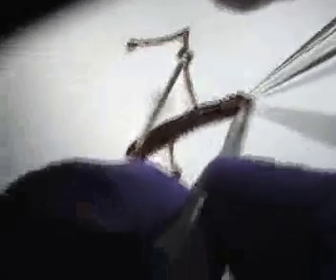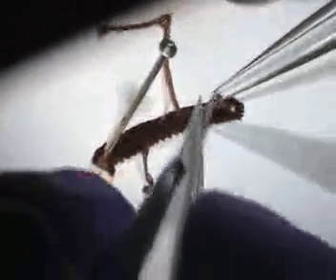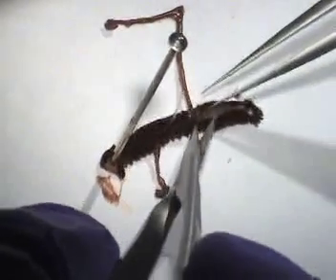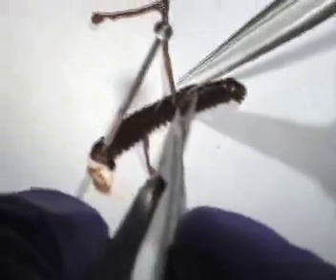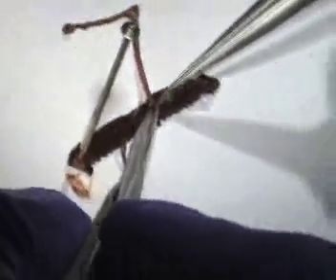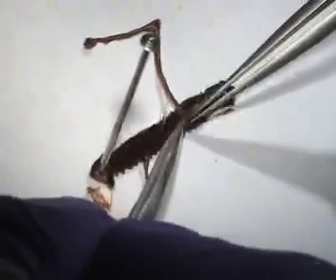That's why I didn't want you to use them carelessly. Well, that's a good thing because I'm actually a terrible dissector. Even if you aren't very careful, it's very easy to do. Sorry, that was gross — she just opened up. Internal organs — I don't like internal organs. It's like a B-shaped thing. That needs to be cut still apparently. So that's not the part of this diagram that's in the uterus.